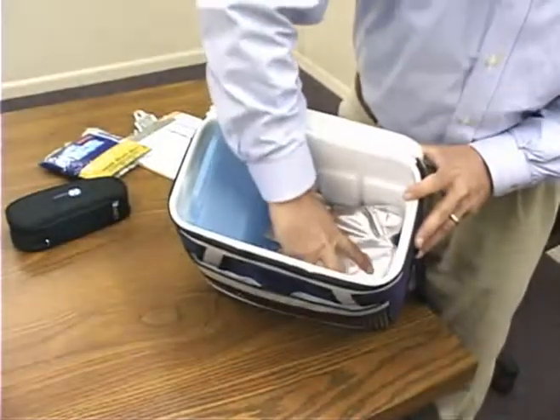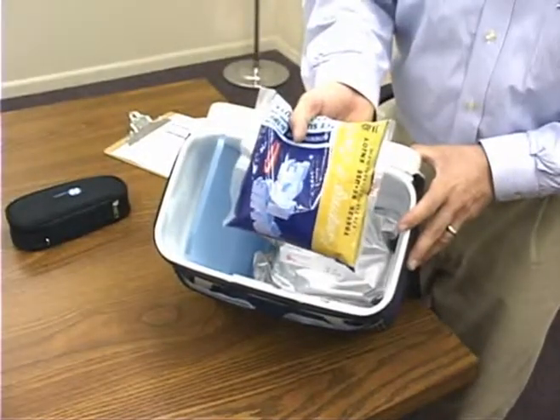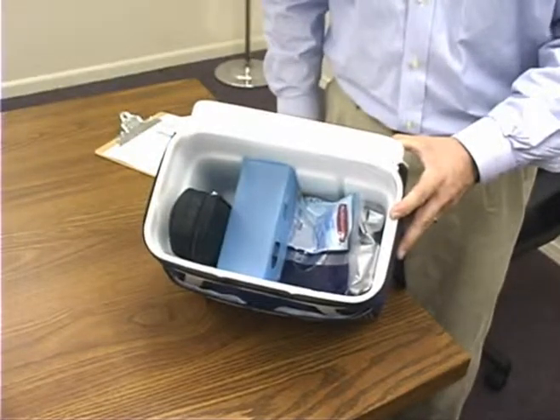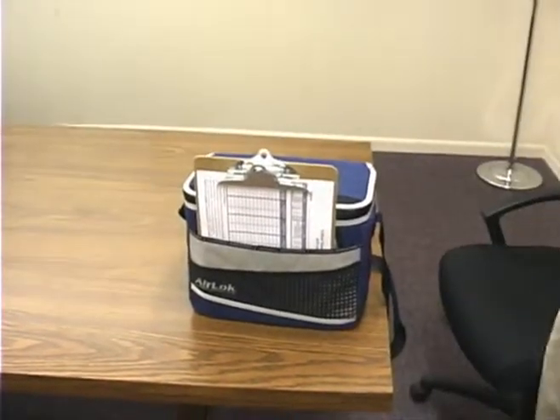The cooler included with your ATP kit helps to ensure your Ultrasnap swabs will remain effective and provide reliable measurements. To transport your meter and swabs, place the ice pack that came with your kit and the Ultrasnap swabs in one compartment of the cooler. The ATP meter can be placed in the smaller compartment for transportation. The clipboard and report form fit in the outside pocket, keeping everything together in a convenient package.